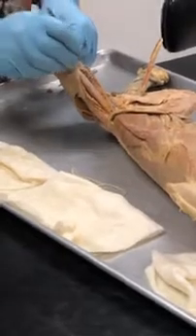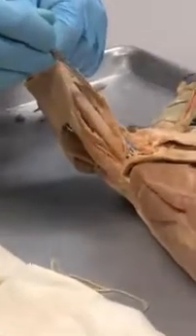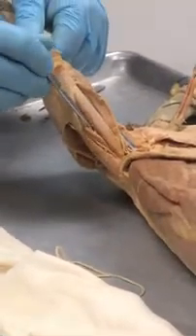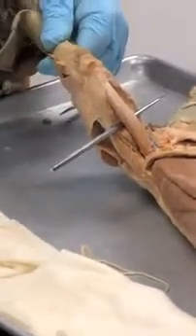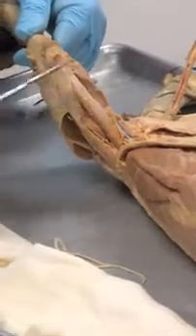What is this middle one? Rectus femoris. What is this one? Vastus medialis. And what's this one over here? Vastus lateralis. And then what's going to be found underneath the probe? Vastus intermedius. Not bad. Okay? It's right where they're supposed to be.